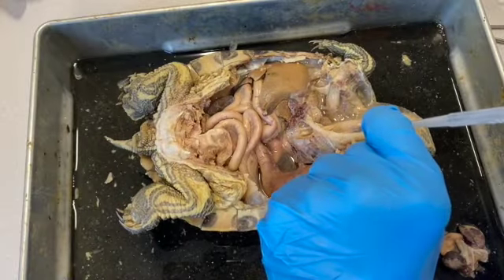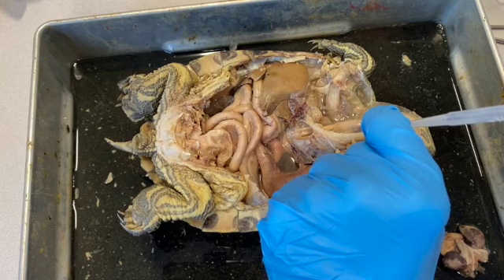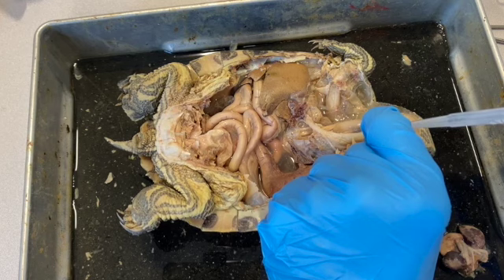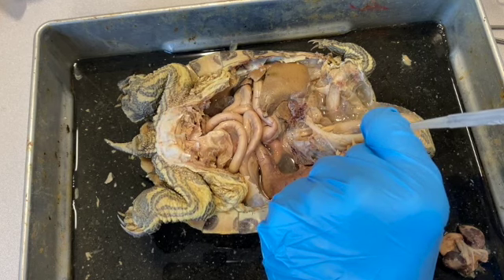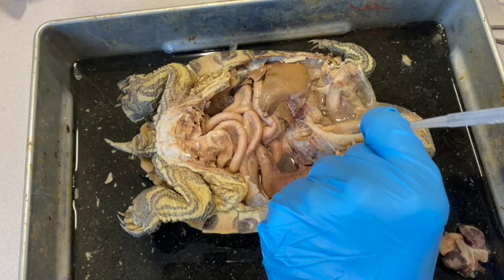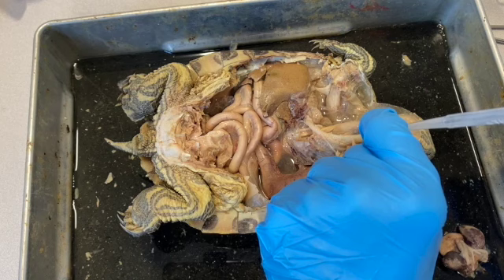Okay, before we go any farther, I want to show you something. I've cut the trachea and inserted the tip of a plastic eyedropper, and there is a hole in one of the lungs, but what I'm going to do is just gently exhale into this and partially plug the hole and watch for the inflation of the lungs.